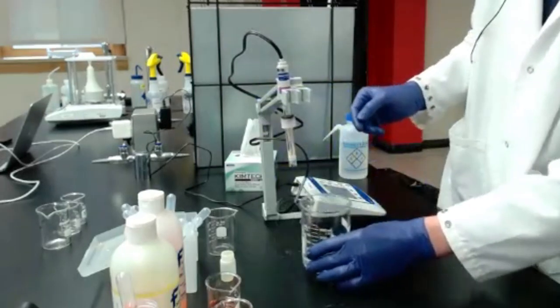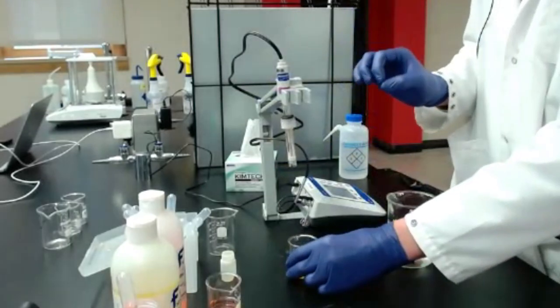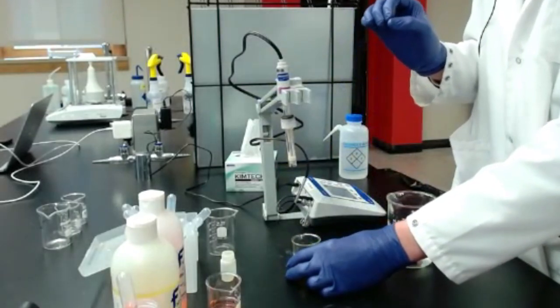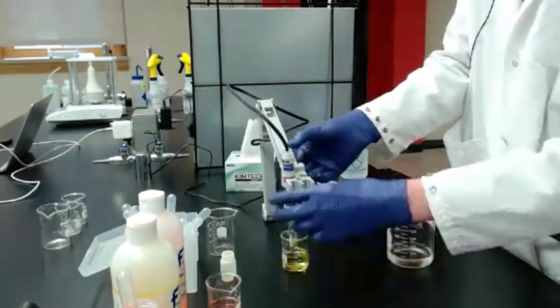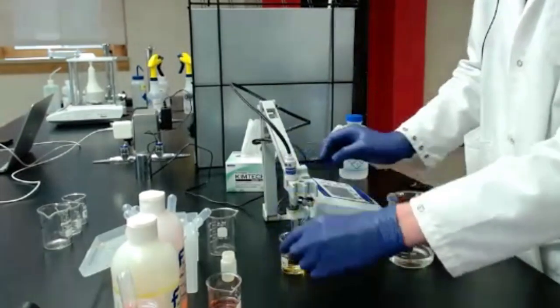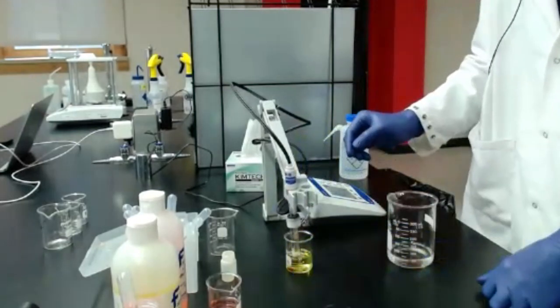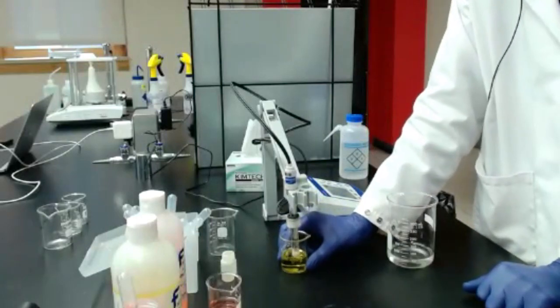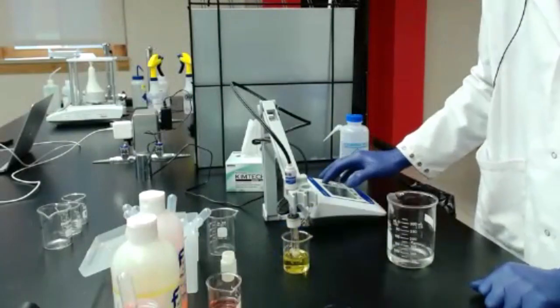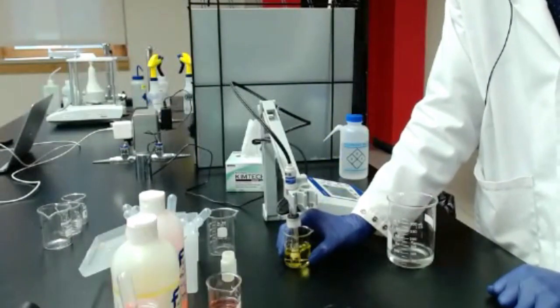Okay, so I've done one buffer. At minimum, you want to do 2. Best is 3, but just to save a little bit of time, and our teaching lab is out of pH buffer 2, so I'm going to move on to pH 7. Hit the standardize button again and wait for a stable reading, keeping that liquid moving a little bit.